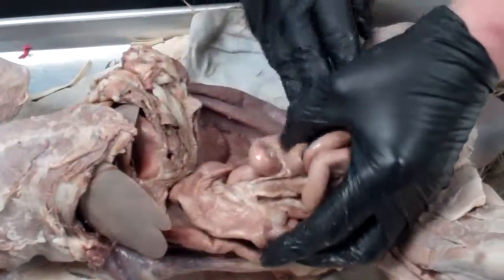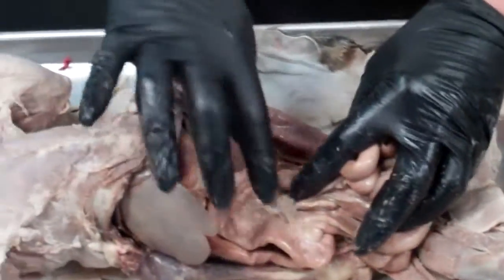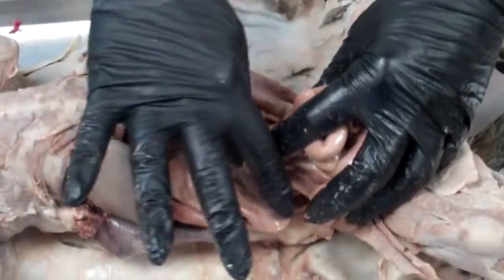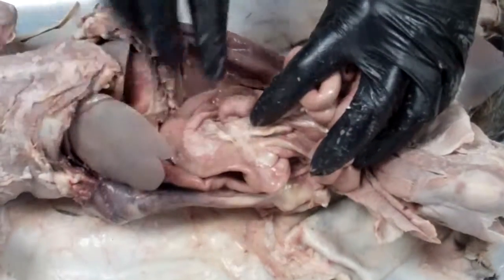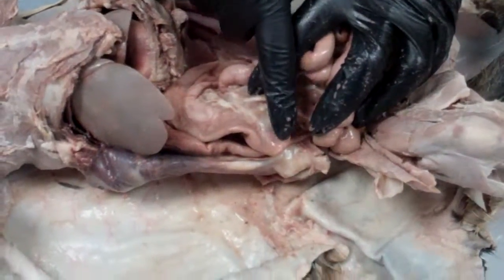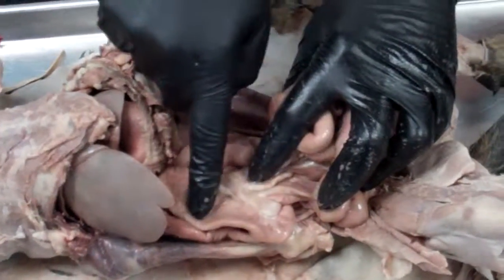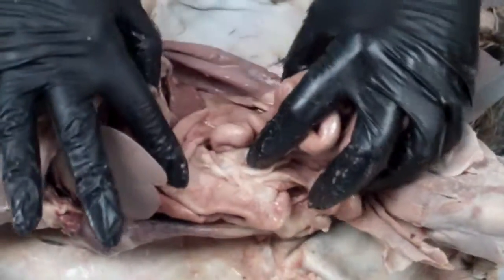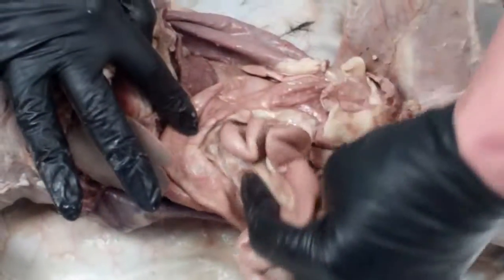All right, then if I pull all of the small intestines out of the way, I can see that the large intestines form kind of an upside down U-type structure here in the abdomen. And the cecum gives rise to the ascending colon. Another name for the large intestine is the colon. This is the ascending colon, where it goes across the body, it's called the transverse colon.